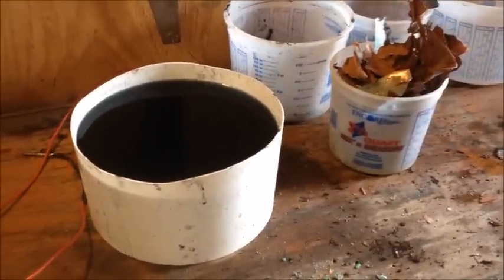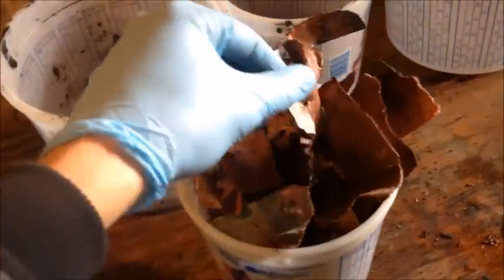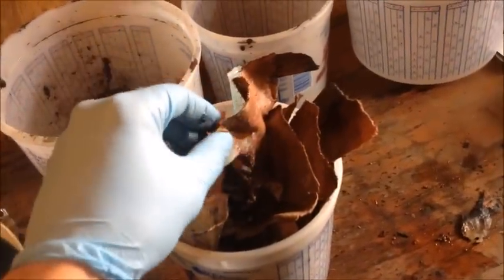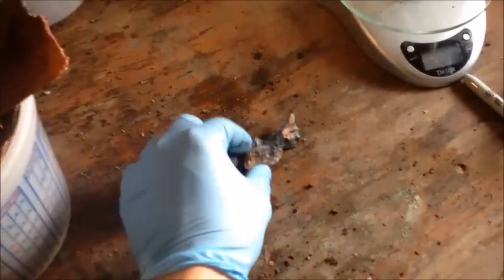It's been nine days since we started and we've finished plating out all three pieces of that bar. Here's a whole bunch of copper we plated off the cathodes, and some other copper that got a little spongy towards the end — it's not a nice solid plate, it's kind of crumbly. The great part is we can take all this copper with its high surface area, even breaking the spongy copper into essentially copper powder, and reuse it for the smelting process.